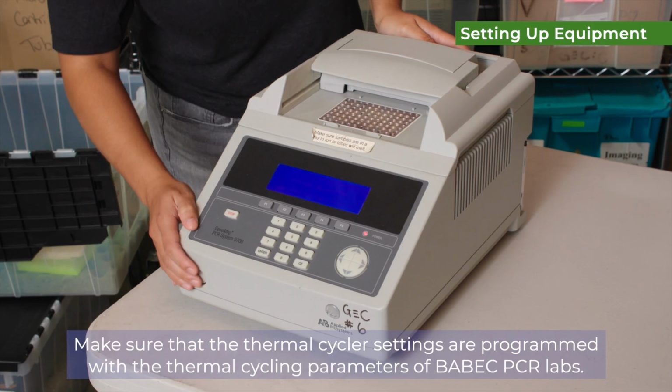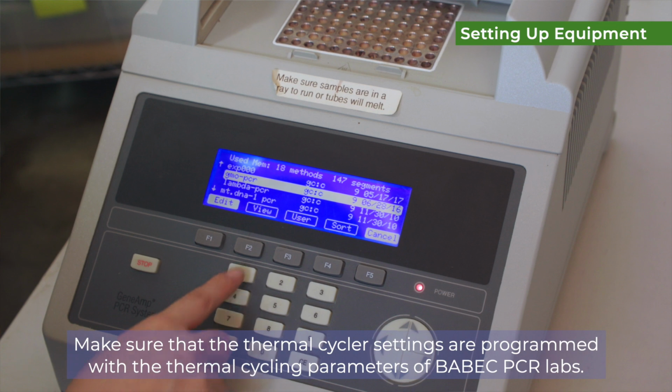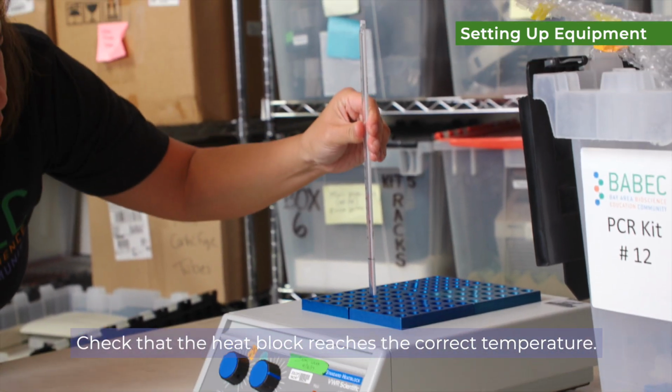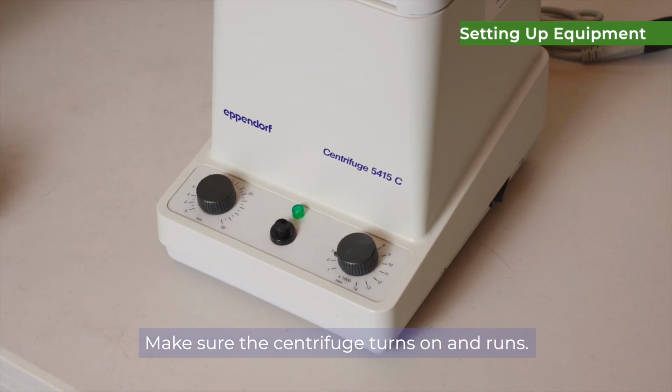1 week ahead of the lab, take some time to check 3 key pieces of equipment. Make sure that the thermocycler settings are programmed with the thermocycling parameters of BABEC PCR labs. Check that the heat block reaches the correct temperature. Note these are dry heat baths. You do not need to put water in the wells. Make sure the centrifuge turns on and runs.